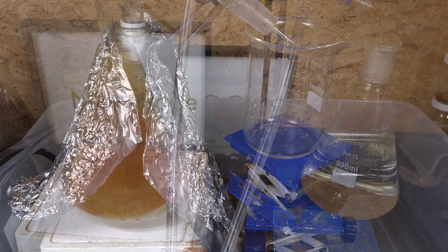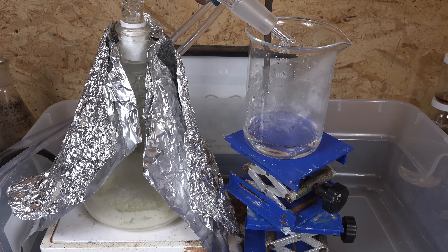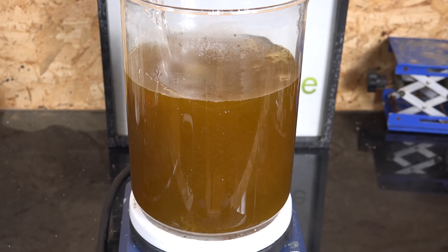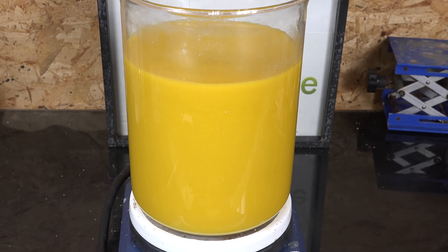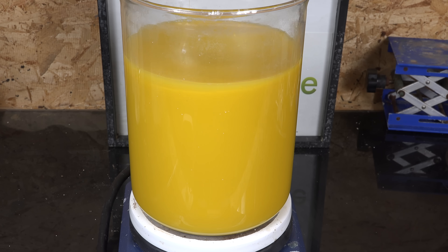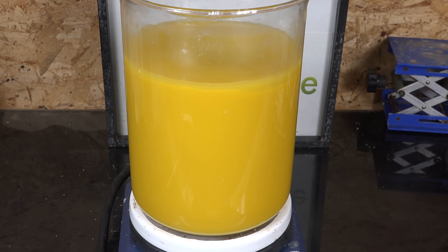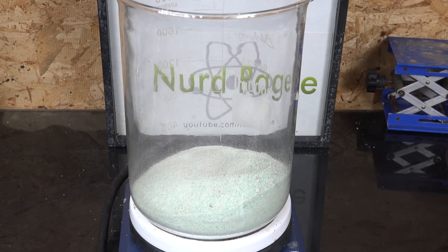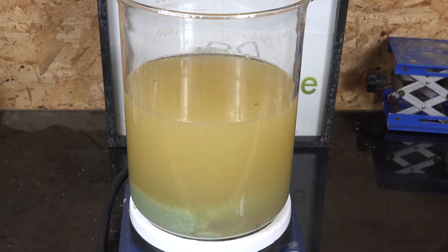In a previous video, I made sulfuric acid by a rather unusual process of precipitation with oxalic acid. Basically, metal oxalates are extremely insoluble, so by mixing the relatively weak oxalic acid with a metal sulfate like iron sulfate, we can make the much stronger sulfuric acid, as the formation of the metal oxalate drives the reaction forward. While somewhat expensive due to the cost of getting iron sulfate and oxalic acid, it was a somewhat viable way to make sulfuric acid.